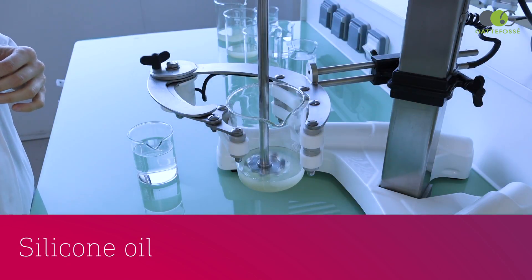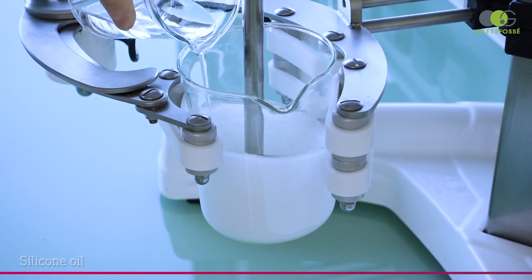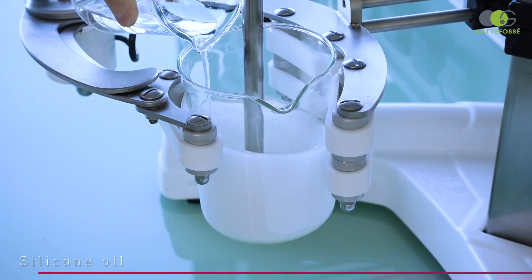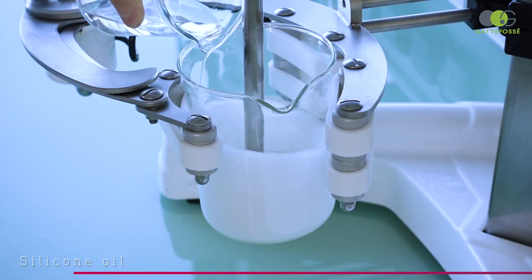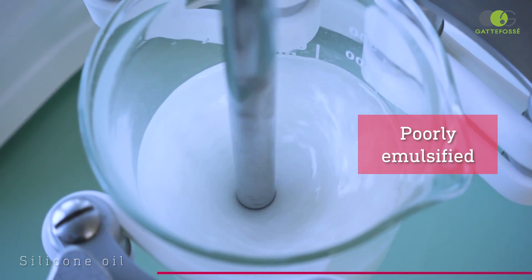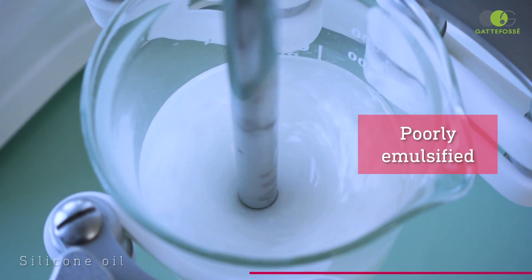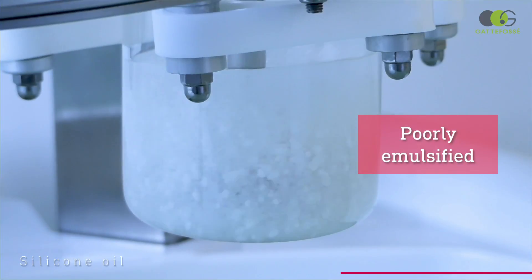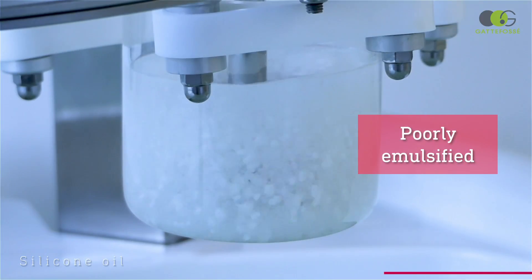We will now see our silicon oil trial. This time, we directly see that the emulsification process is disturbed. The two phases do not mix properly.